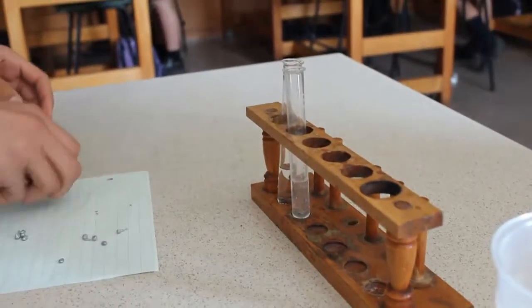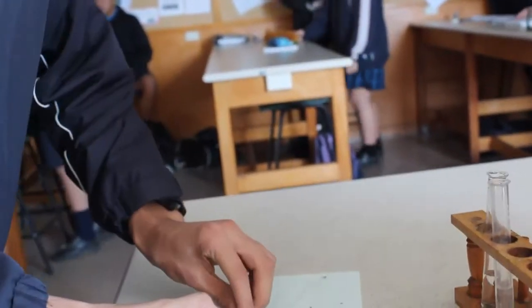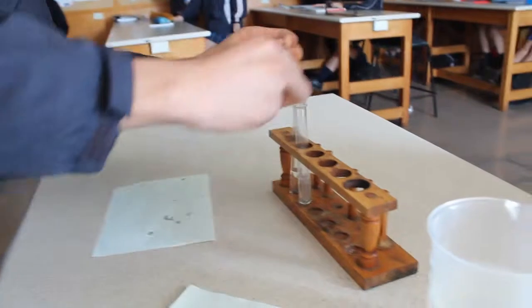Now we're going to put about four pieces of zinc into each test tube to compare the reaction.